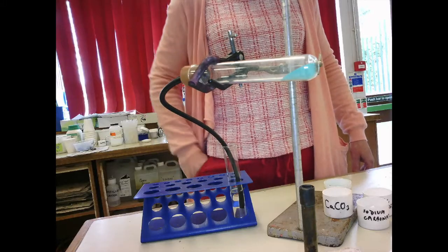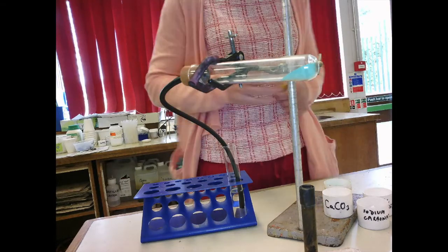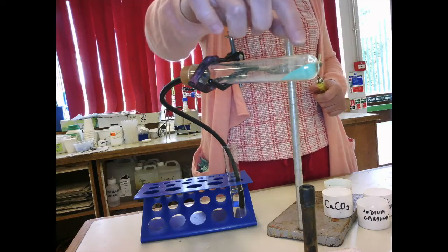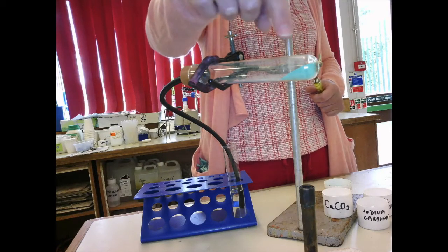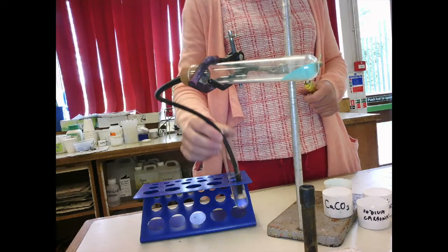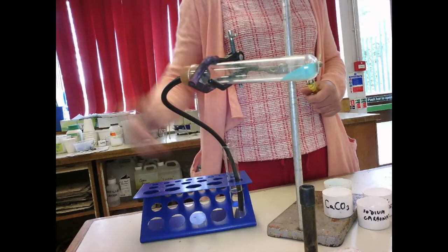Right, this is your 10 triple again, decomposing carbonates. What I've got here, I've got a boiling tube. In the end of the boiling tube I put copper carbonate for this demo, and we've got a delivery tube and a stopper, and that's going into lime water which is in this boiling tube here.